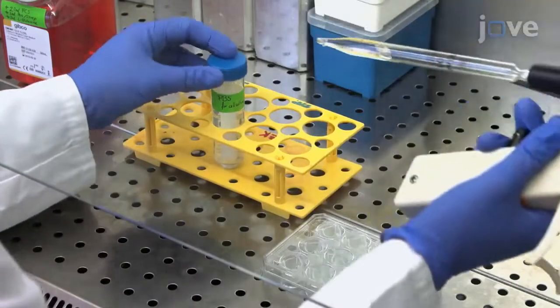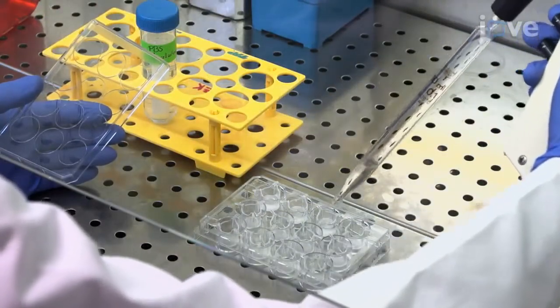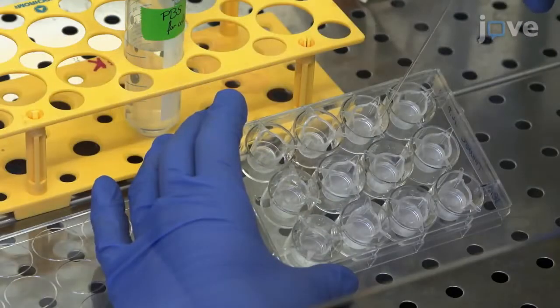After the incubation, wash the inserts twice by pipetting 1 milliliter of PBS into each insert and aspirating it with a vacuum pump.